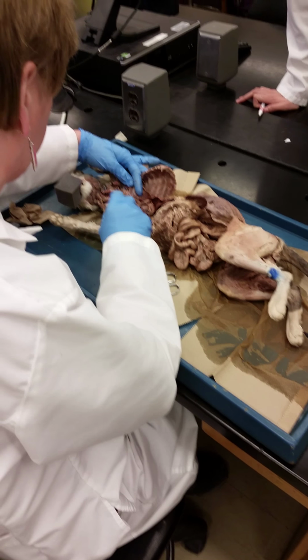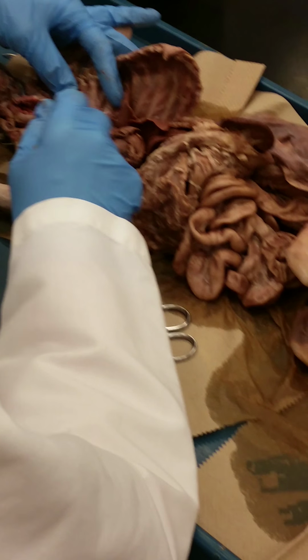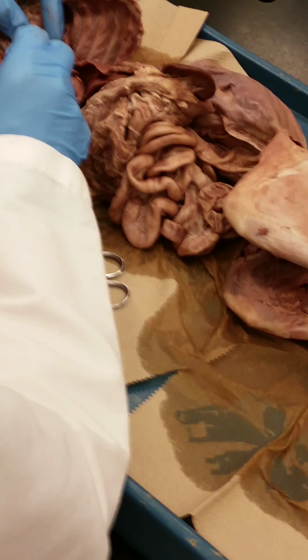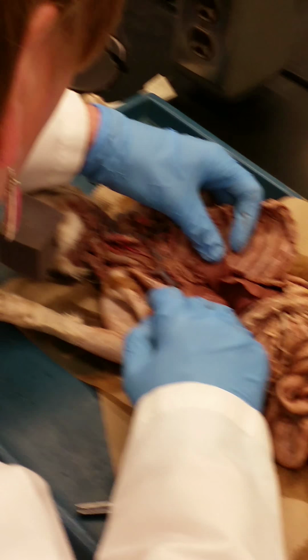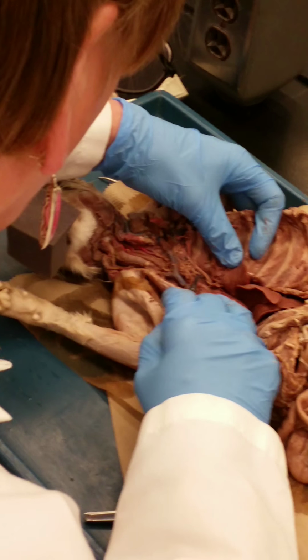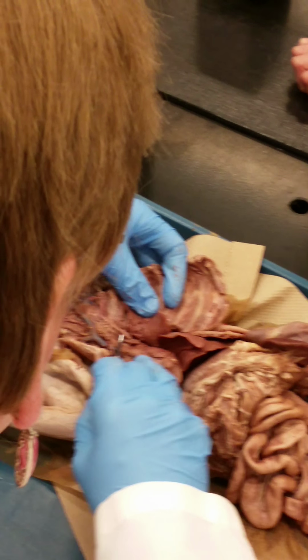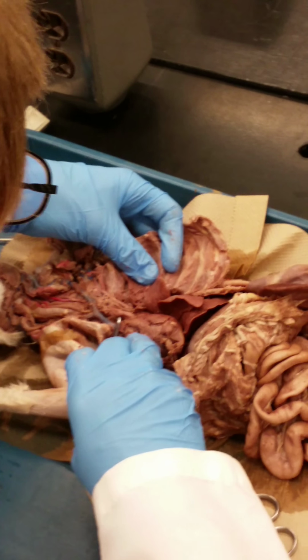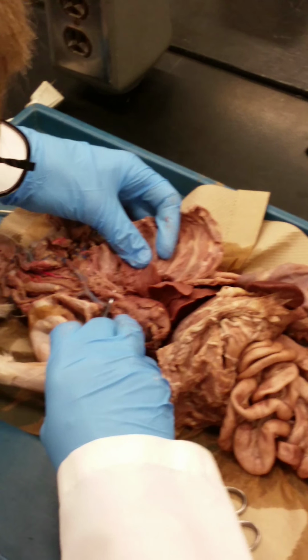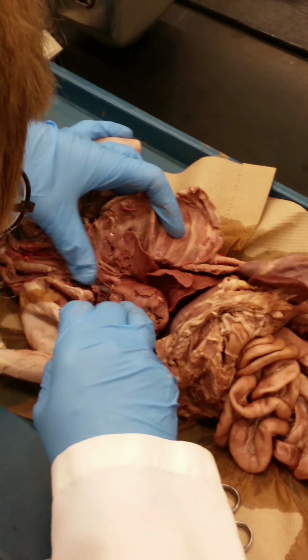He's a very nice kitty in that everything is dissected out very nicely and cleanly, even though it's a small kitty. So if we start at the base of the heart here, we have two large vessels coming out of the arch of the aorta. The one on the left is the left subclavian artery, so you have to tell me left on that, because the one on the right is not the right subclavian artery. This would be the brachiocephalic artery, so there's only one of those.